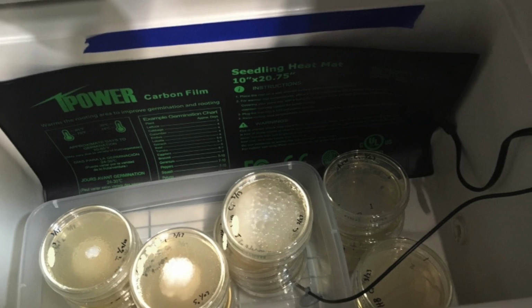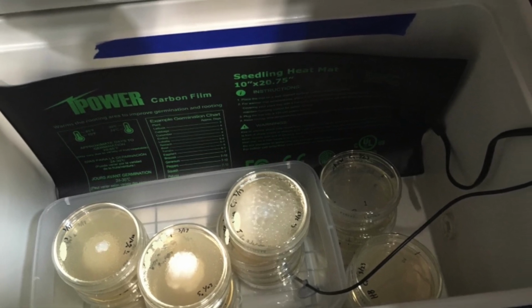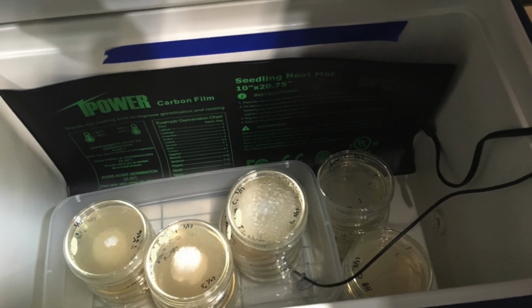Plates then go into an incubator at 77 degrees Fahrenheit, and that's been used in the past with plenty of success.